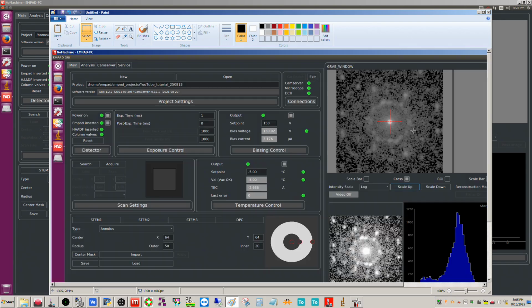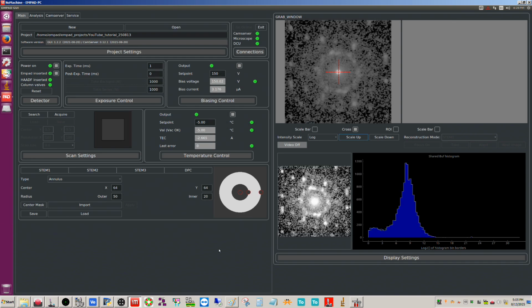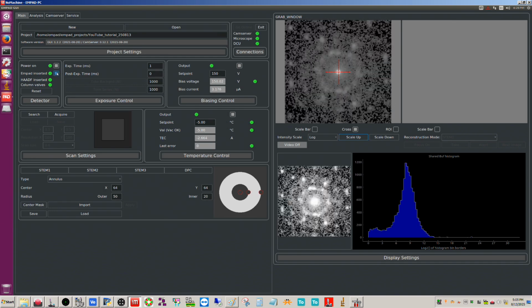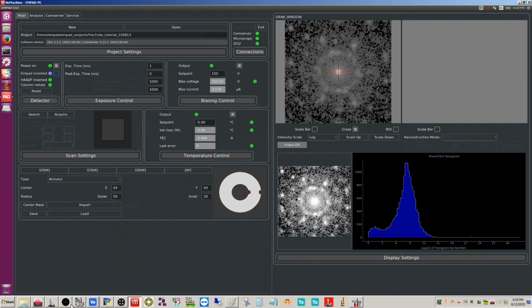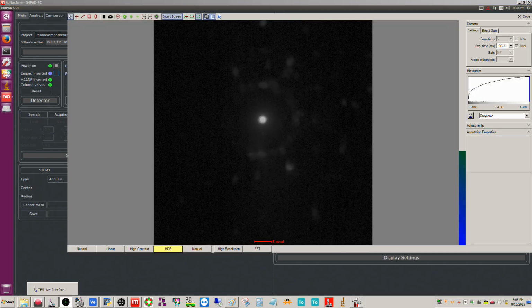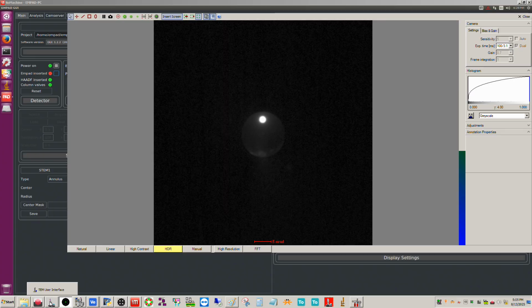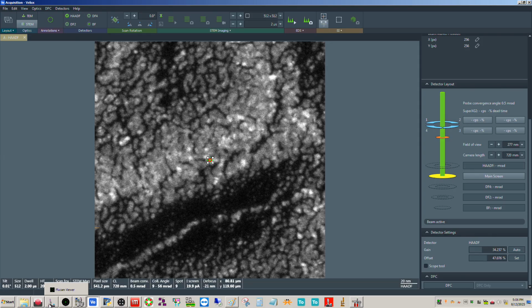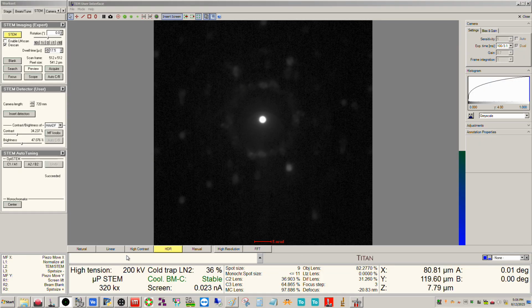Okay, so there's our diffraction pattern right now, and I'm going to take the EMPAD out, my bad. And let's take out the HAADF because that's in the way. So we'll take that out. And hopefully we can, okay, so what I wanted you to see here, and hopefully this is easy to see.